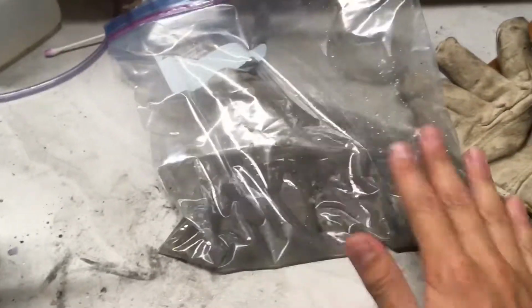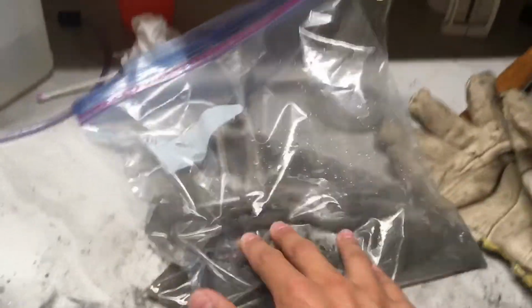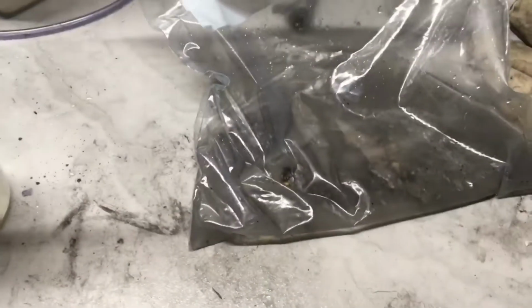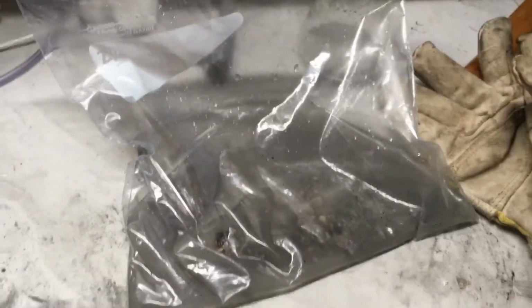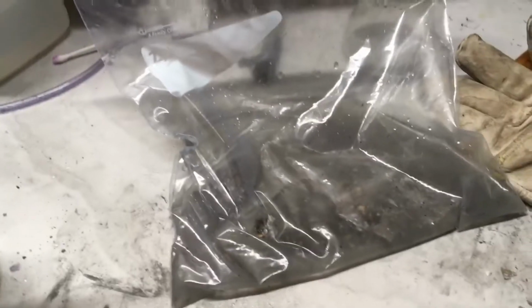As I said, the gray stuff is carbon ash, so we'll filter that off later on with the filter paper. If there's some white stuff left, like you can see right there, it's probably just unconverted eggshell or some sort of other non-water soluble impurity. Don't worry about it, it'll be filtered off if it doesn't dissolve.